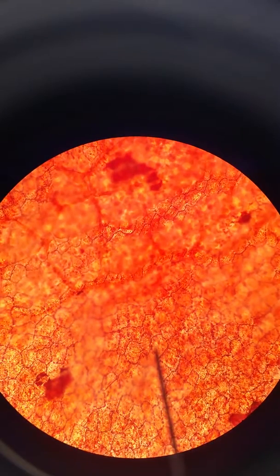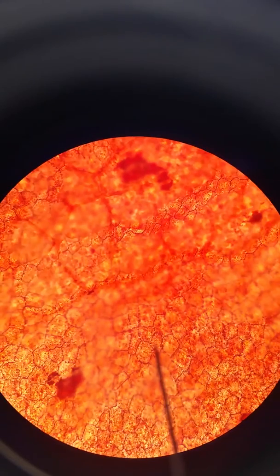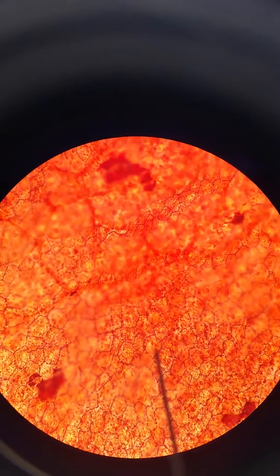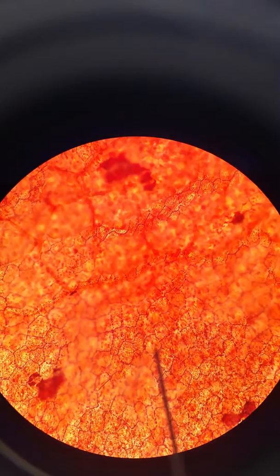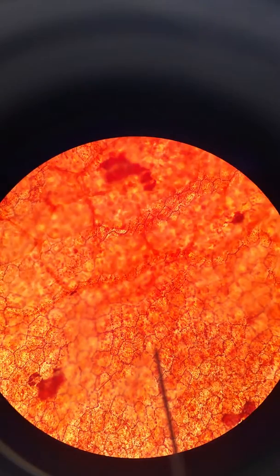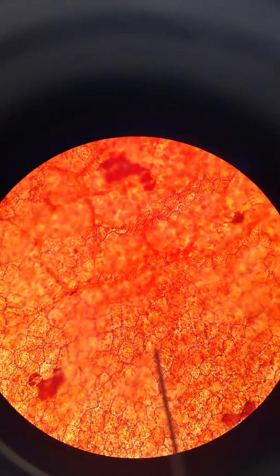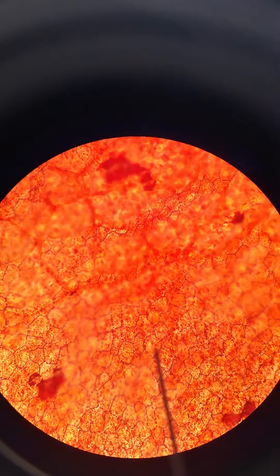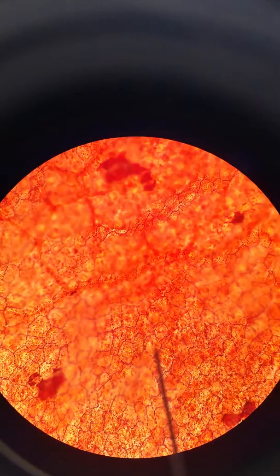I've got the tip of the pointer right in the middle of one of those cells. These are very tightly packed cells — there's no gap or space in between the boundaries of these cells. That's one thing you can notice as a classic example of an epithelial tissue.